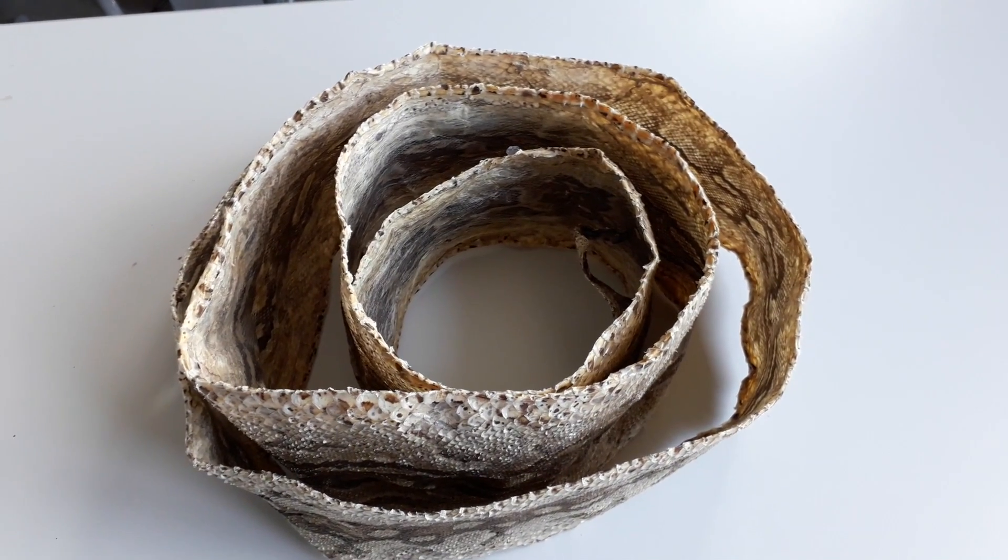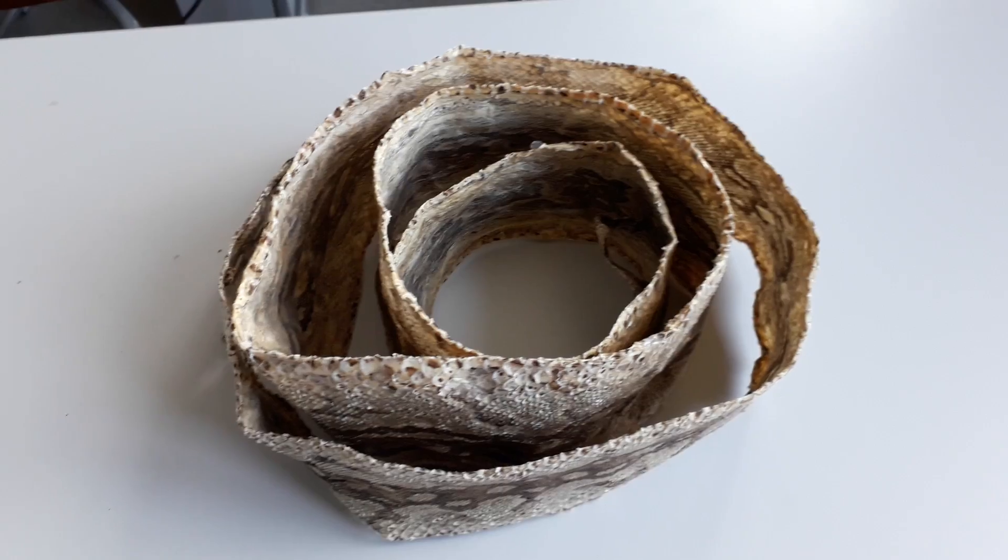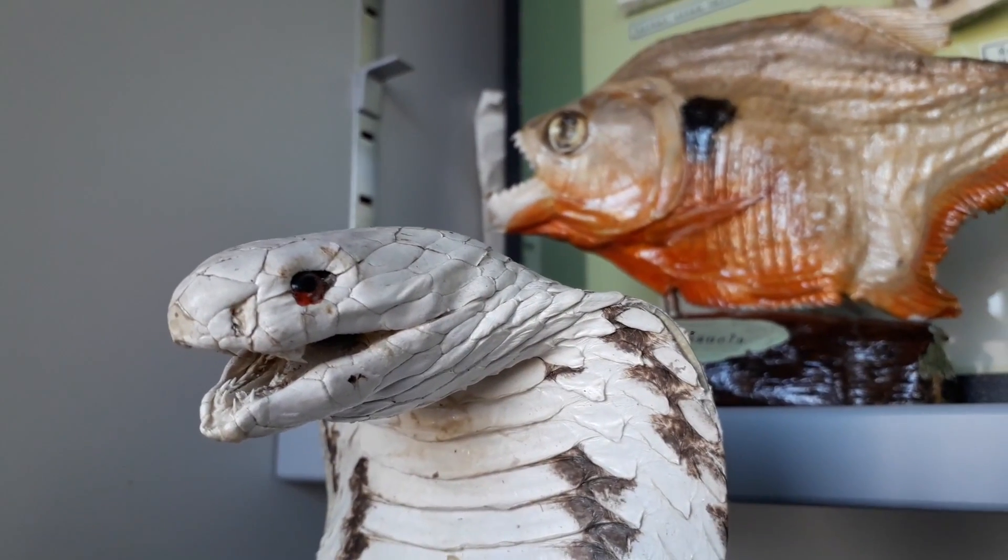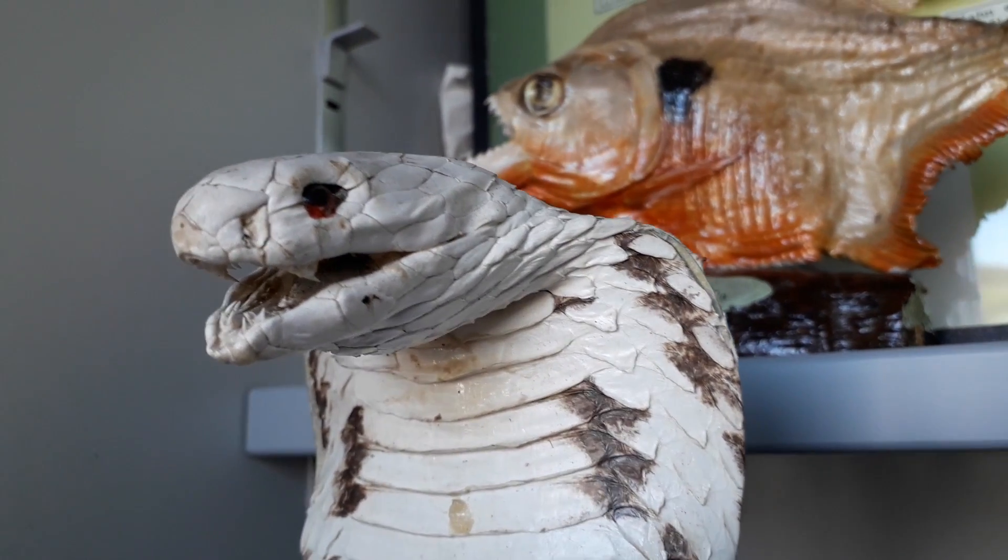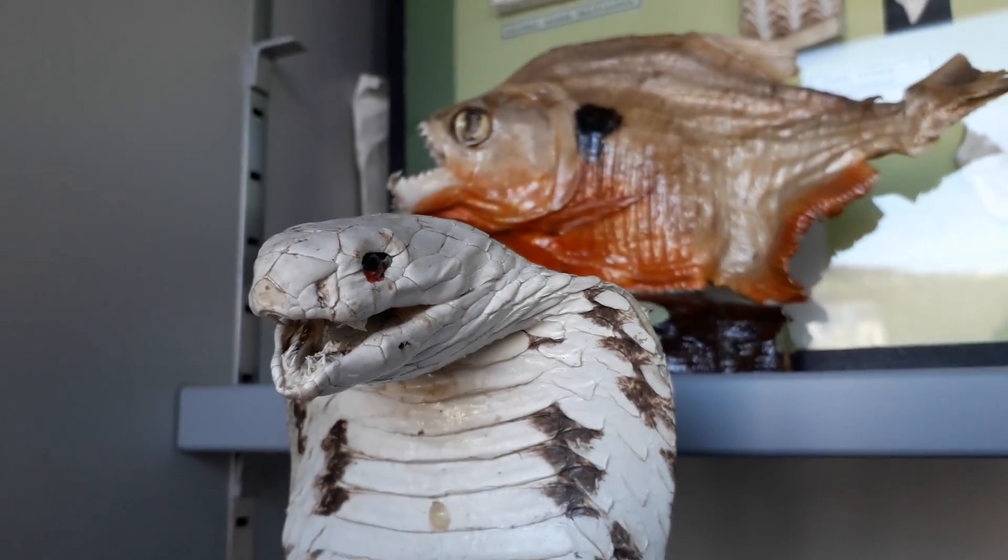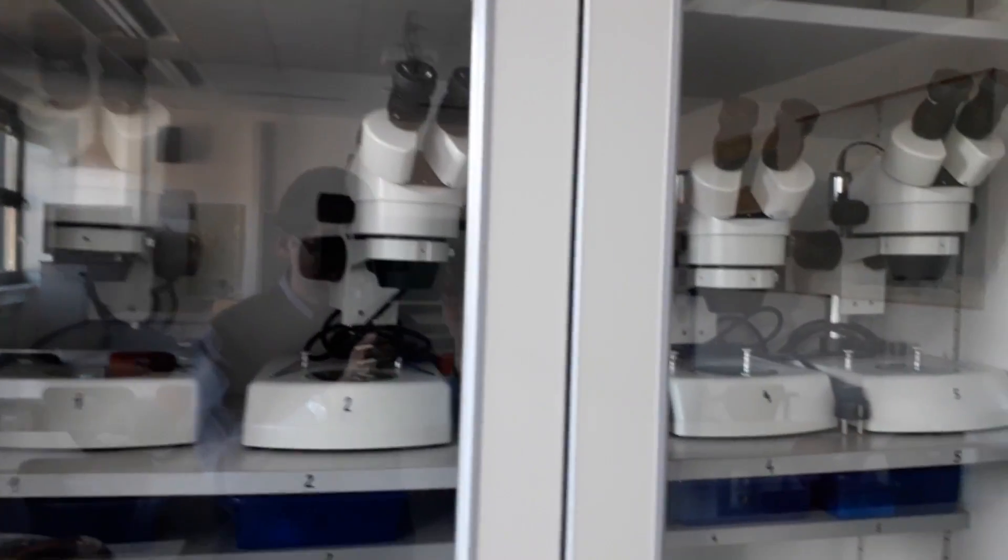It's rolled up like this. We use this as a demonstration object for our students. We also have a whole bunch of other prepared samples. This snake here is a real one, or at least it looks pretty real.